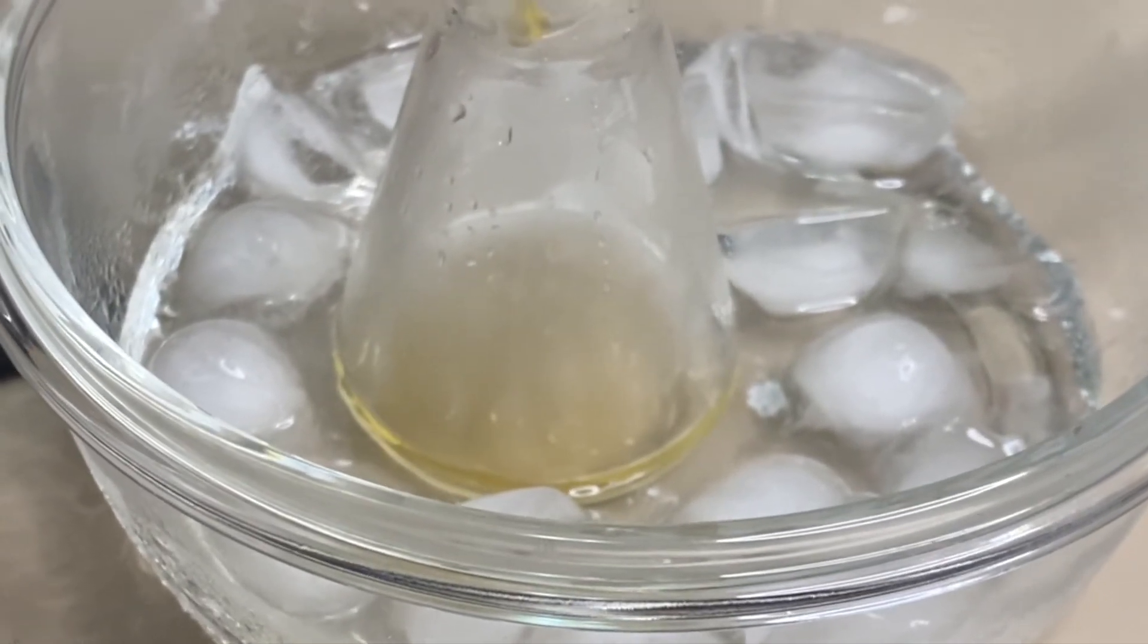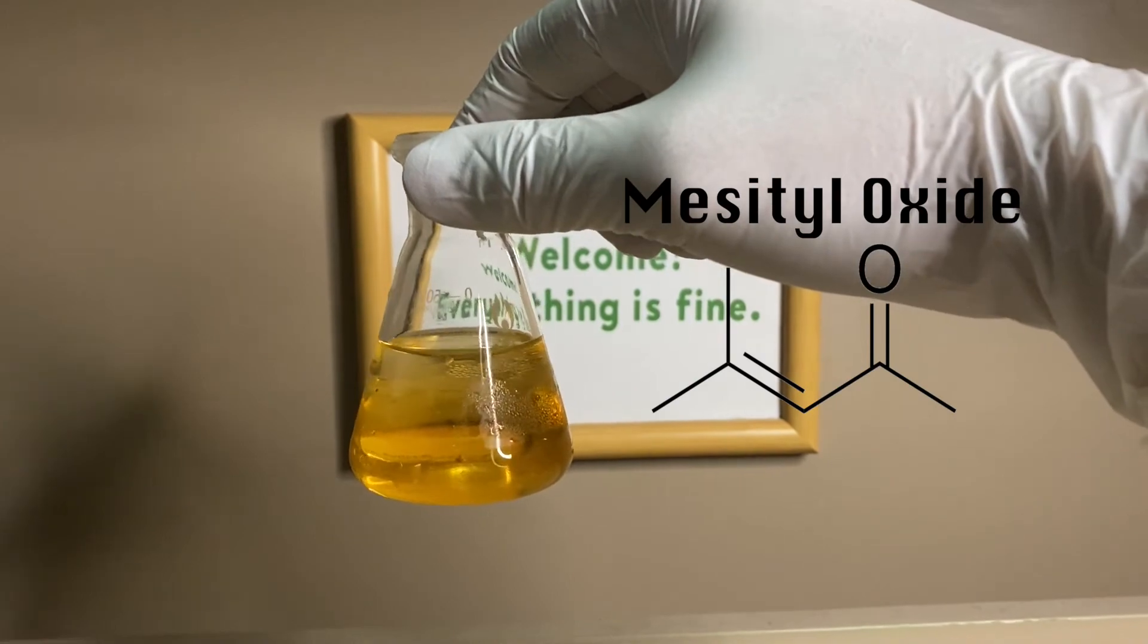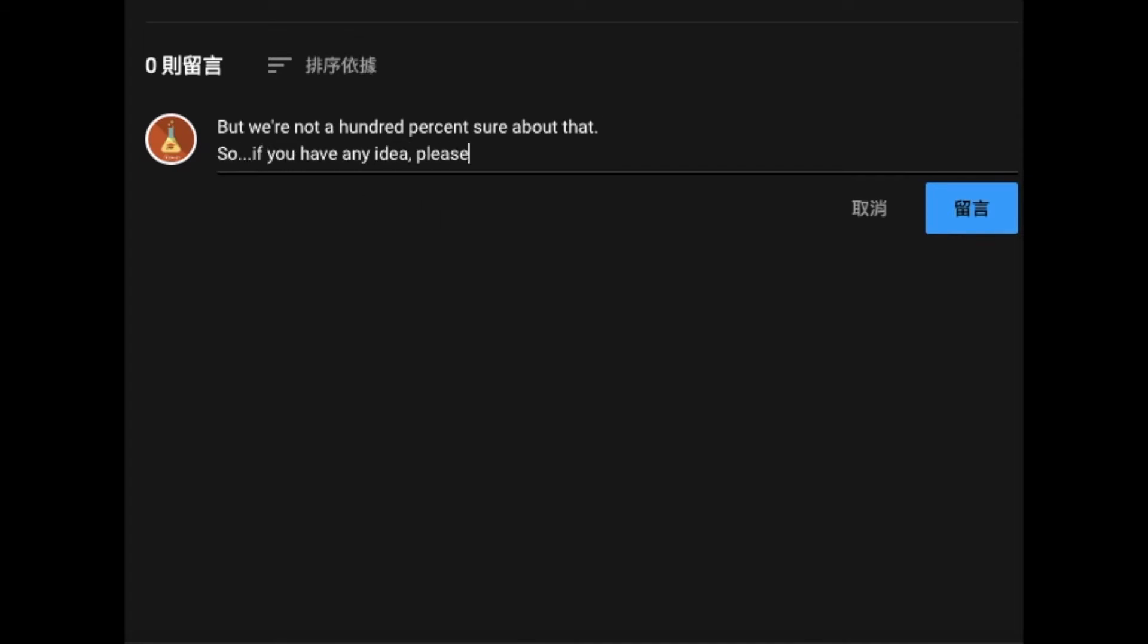We believe the major byproduct formed here is the aldol-condensed acetone mesityl oxide, but we're not 100% sure about that. So if you have any idea, please let us know in the comment section below.